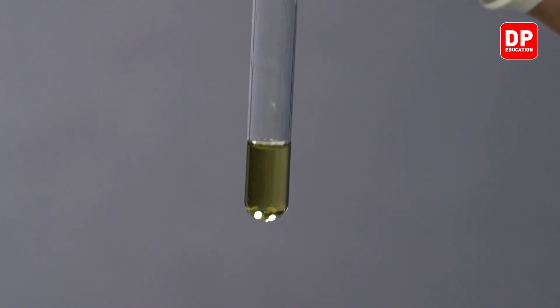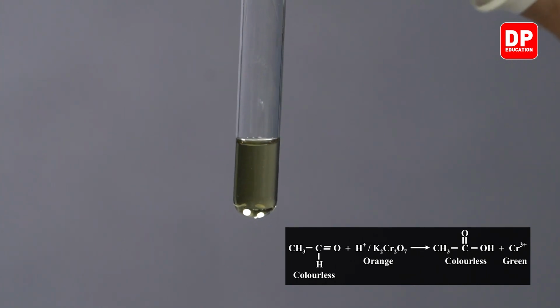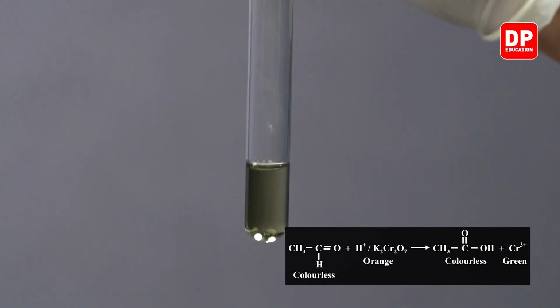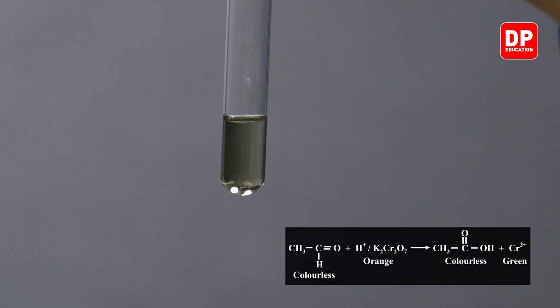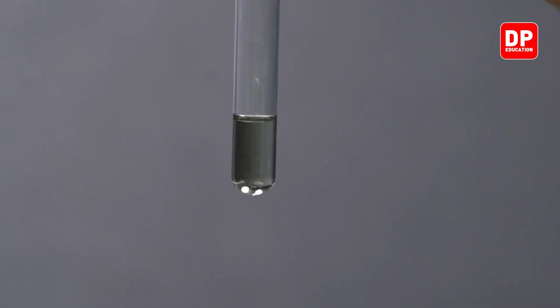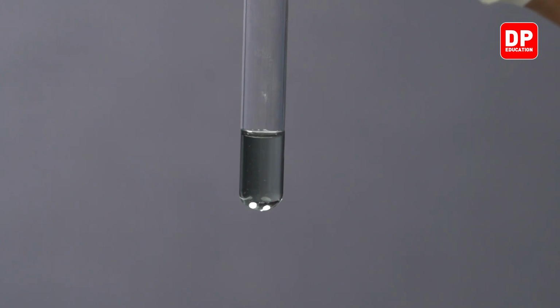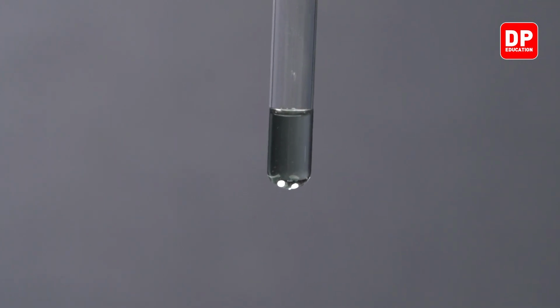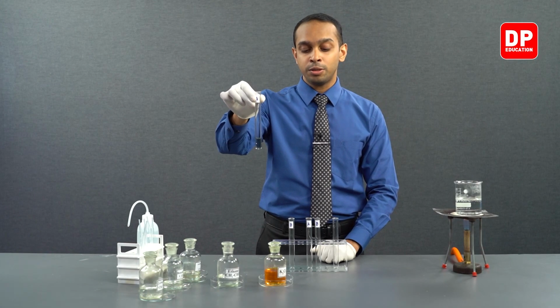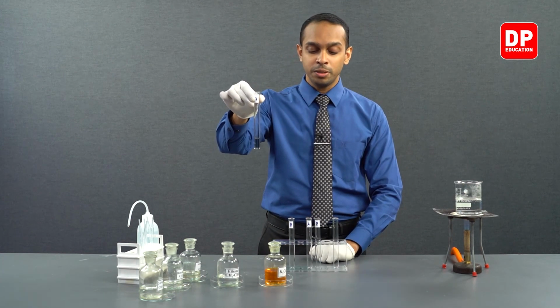The reason for this is that acidified potassium dichromate is also a good oxidizing agent. So it can oxidize the acetaldehyde into acetic acid, or in other words, ethanal will be oxidized into ethanoic acid. When this is happening, the dichromate ions present in the medium are the responsible species for this orange color in the dichromate solution.